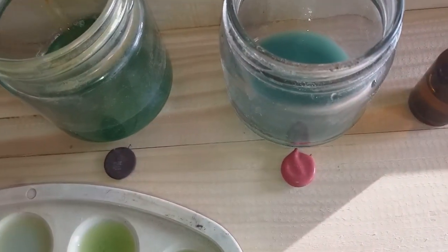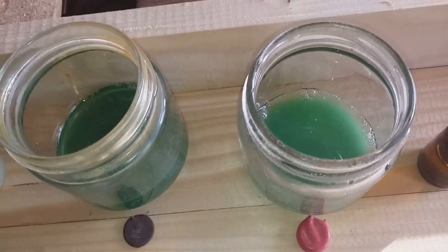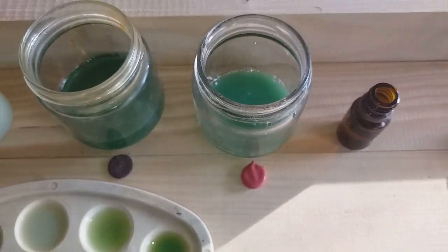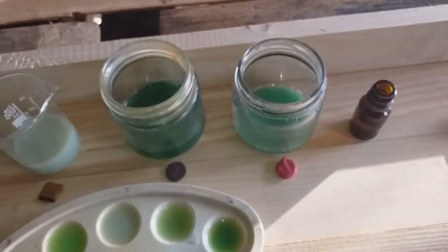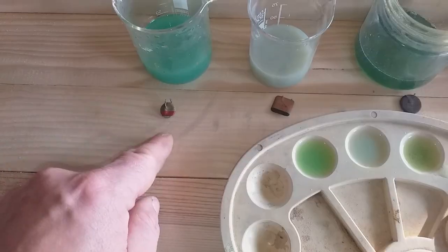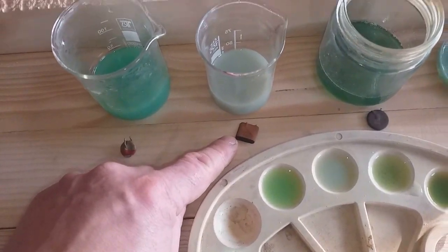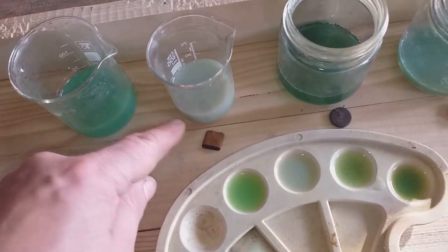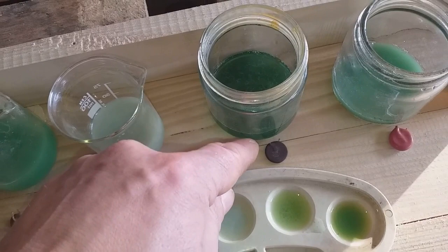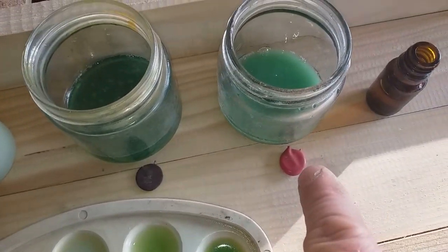And the red one got some little reaction here. I got some very, very small reaction here. My camera cannot show you, but I see a very small reaction here. So on the end, let's see the summary of this video: the first capacitor contains a solid trace of palladium but no silver. The second one, square one, contains a small trace of silver but no palladium. The black one contains just a small trace of palladium and no silver. And the red one gives a very good reaction on palladium but a small reaction on silver.